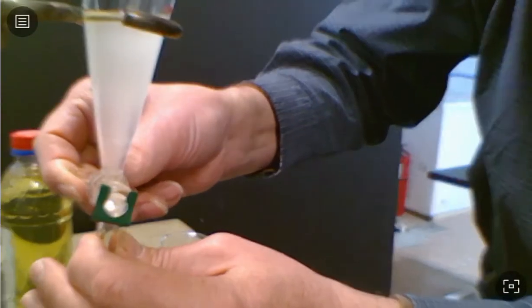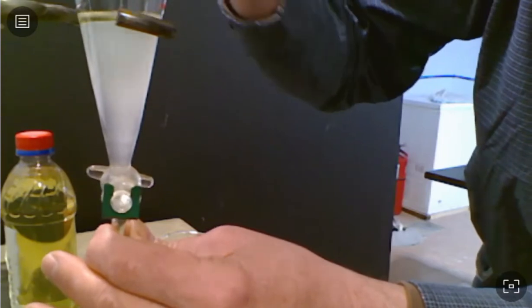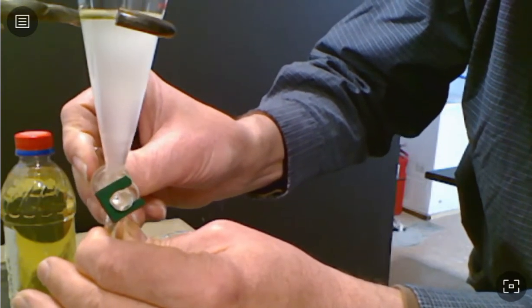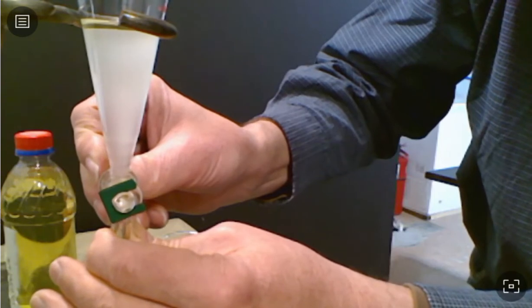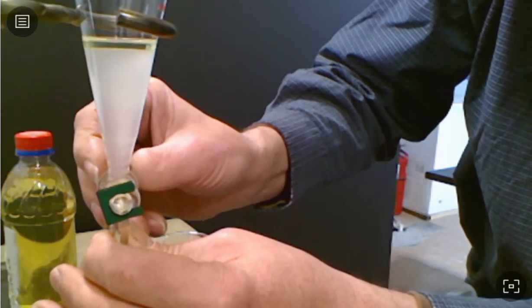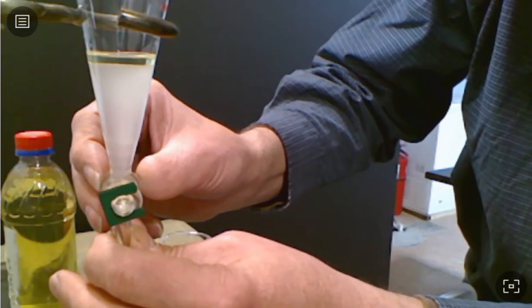All right, so first thing I got to do in order to get it to drain very well, I got to take my stopper off. I'm just going to allow the water layer to come off the bottom. As I do, you can see that it kind of looks like the gasoline layer gets a little more volume, but it's actually just moving to a smaller part of the flask.